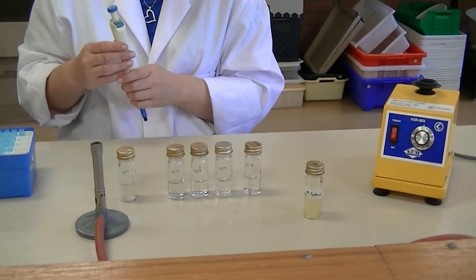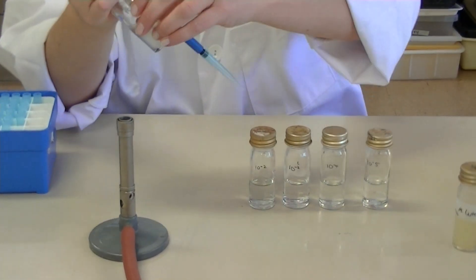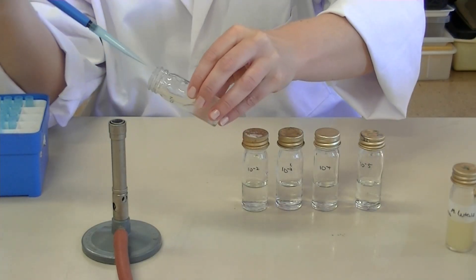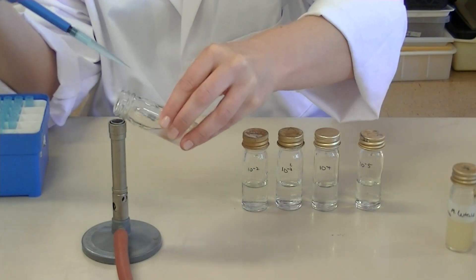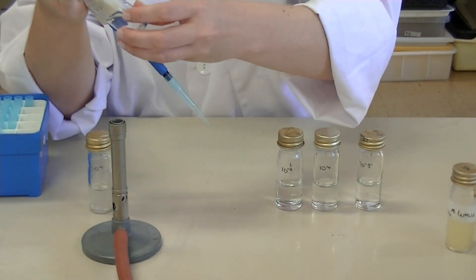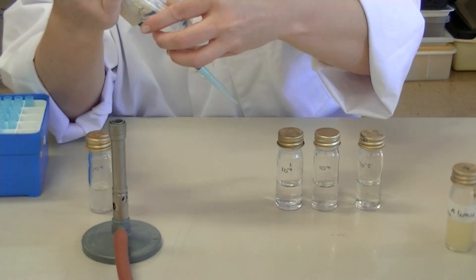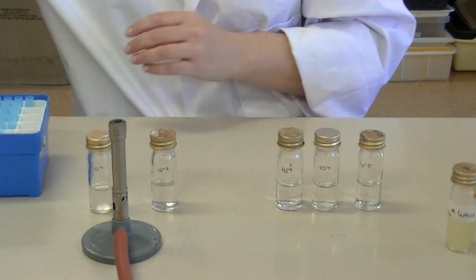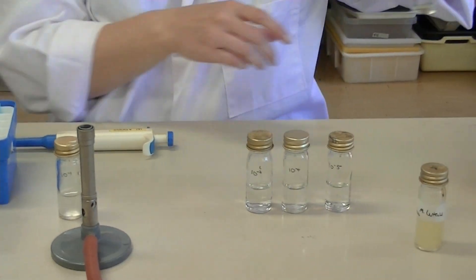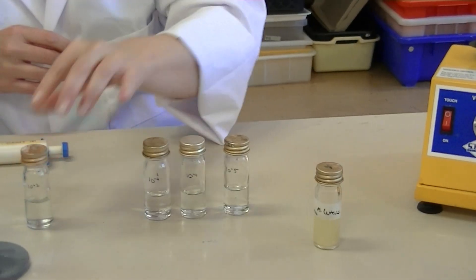To perform the 10⁻² dilution, grab a new tip on your pipette and aseptically transfer 1 mil from the 10⁻¹ bottle. Using the crook of your finger, remove the lid, flame the neck, collect 1 mil, flame the neck, replace the lid, loosen the lid of the 10⁻² bottle, flame its neck, transfer the 1 mil, flame the neck, replace the lid, and eject your tip. Give it a quick mix on the vortex for a few seconds.